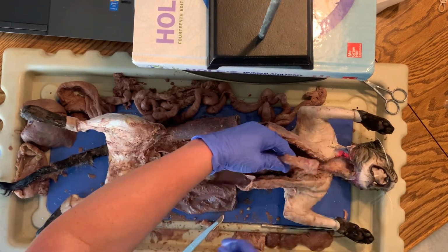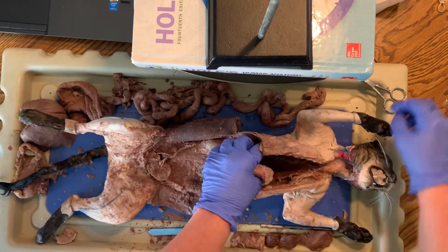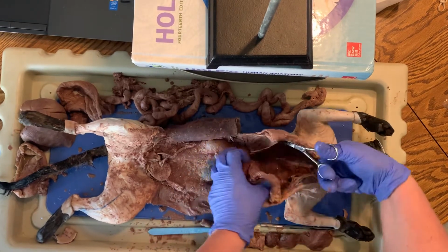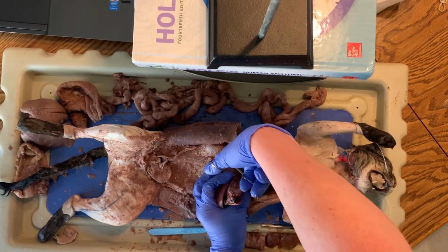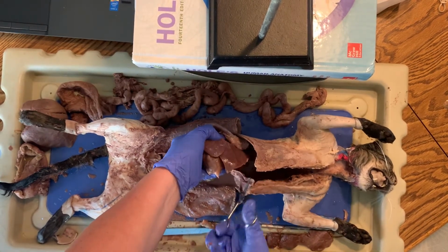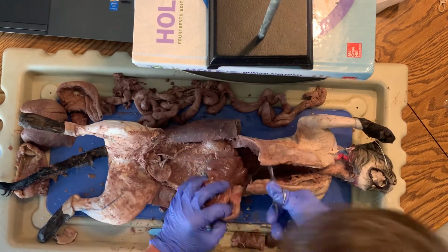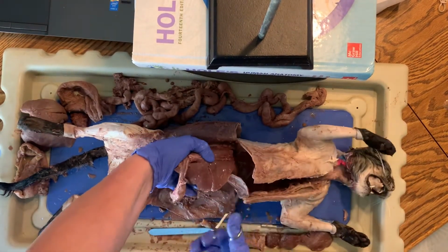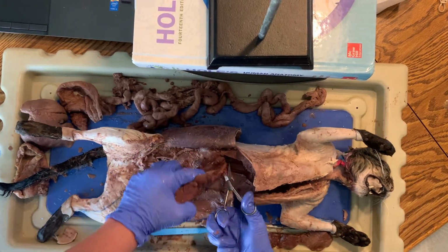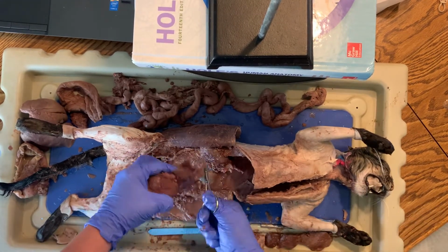And so what I did is I already cut almost all of this out for you. So I'm actually gonna pick the whole thing up for you. I wanted to do the last couple snips for those who were interested in seeing how this whole thing is actually in there. A lot of connective tissue holding everything in our bodies. A lot of arteries and veins. And there's the sidewall muscle.